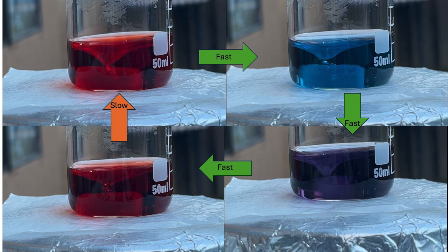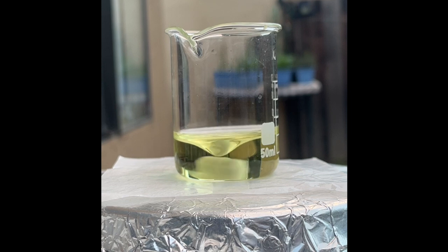Similar to the Ferroin-only version, this reaction can also be performed in a beaker. Oscillating color changes would occur. In this beaker, I added 14 milliliters of solution A, 2 milliliters of solution B, and 1 milliliter of solution C. After waiting for the solution to become colorless, indicating that all bromine had been consumed, I added about 0.2 milliliter of solution E, which gave a yellow hue due to the cerium-4 ions.